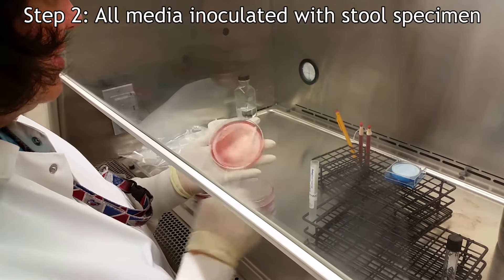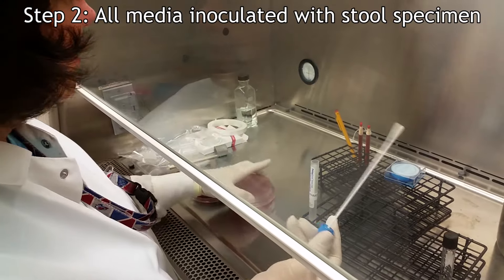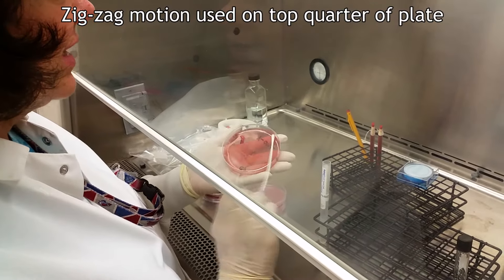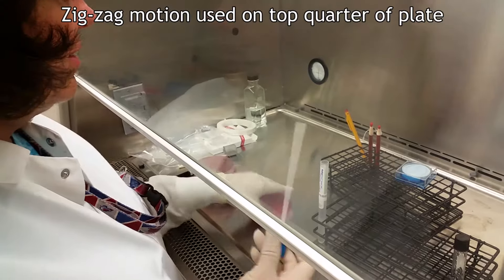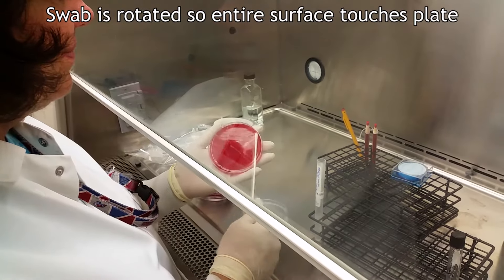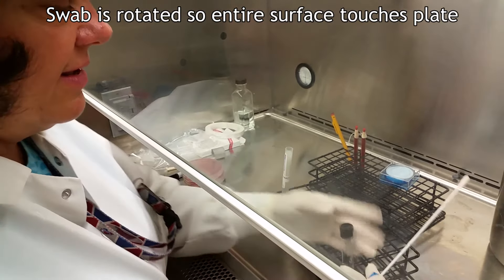Now the plates are inoculated with a stool sample. The stool-covered sample swab is run in a zig-zag motion over the top quarter of each agar medium plate. The swab is rotated so the entire surface touches the plate media.